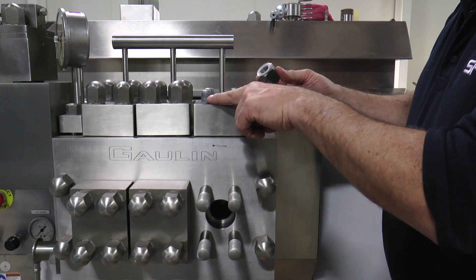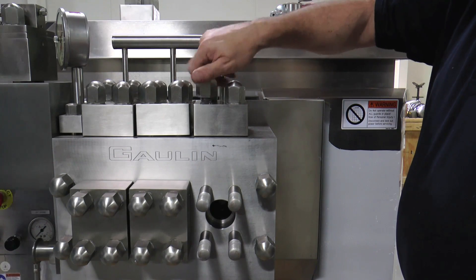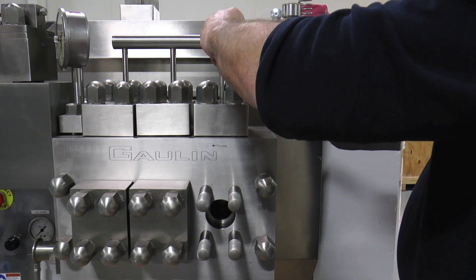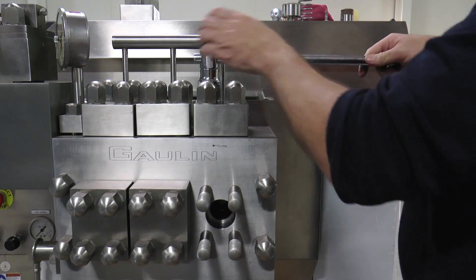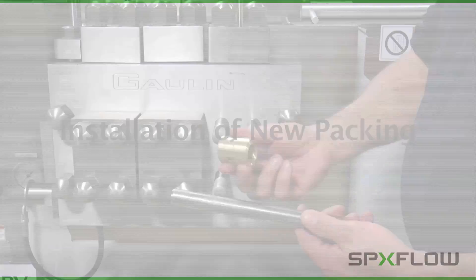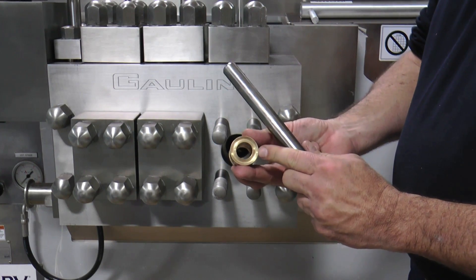Check to make sure there is a food grade anti-seize compound on the nuts and threads of the studs. Install the nuts on the studs, being aware that the studs for the top caps may be a different size than the studs for the front caps. Use a socket wrench to tighten the nuts in a cross pattern. Do not tighten completely — snug them down hand tight initially, then in a second and third cross pattern to secure evenly. It is extremely important that all four nuts be evenly tightened. Once the check balls are installed, the new packing can be installed. Always use genuine OEM packing supplied by SPX Flow. The first step is to install the brass packing adjustment ring — slip it over the plunger.